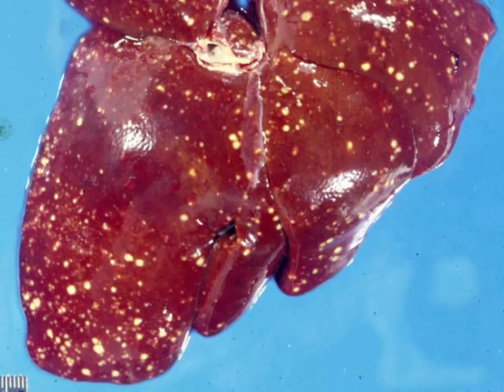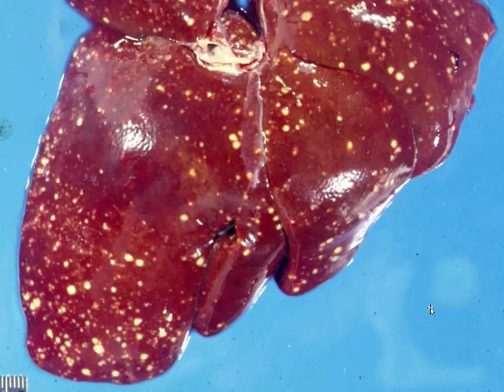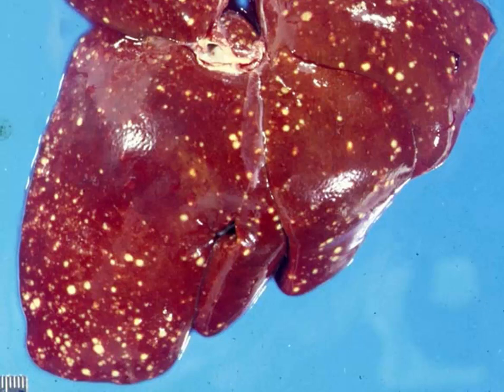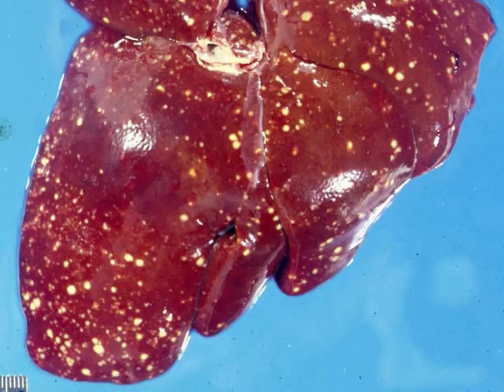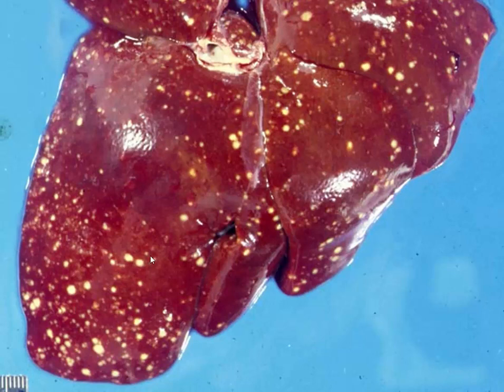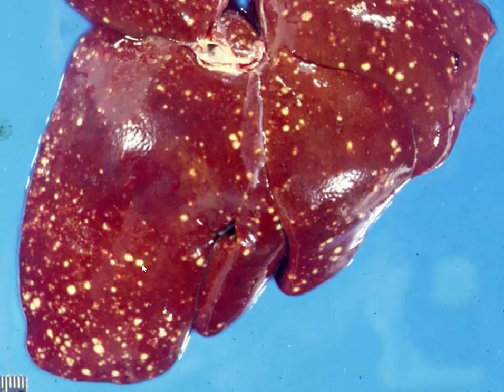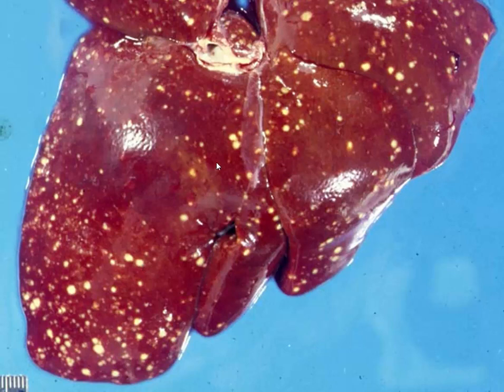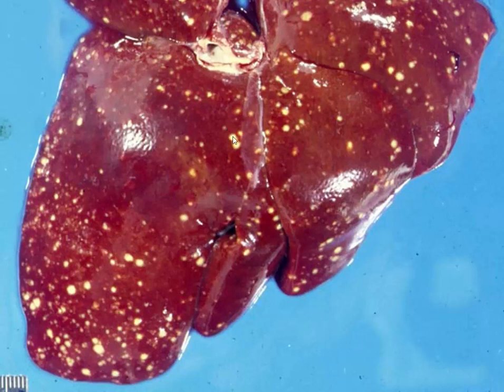Slide number three is a goodie from the collection of John King, and this is from a cat. I would like for you to give me a morphologic diagnosis, a cause, and name another affected organ. We're looking at the liver of this cat, and we see multifocal to coalescing areas of either necrosis or suppurative inflammation — it may be a little of both. They are variably sized, so some are more recently developed than others, and others are more longstanding and will be larger.